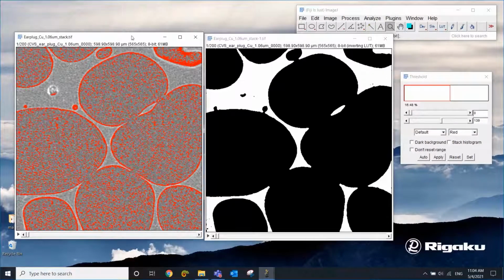Okay, so this is kind of a very basic overview of smoothing filters. And as I always talk about, there are better ways to do this. You can use machine learning or deep learning, but I think it's good to know how traditional, conventional image processing and segmentation works. But when you do this, smoothing for example, always remember that you are manipulating the original image, and that manipulation can cause artifacts.